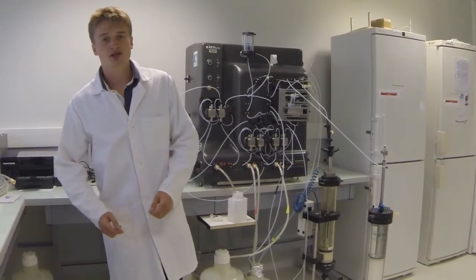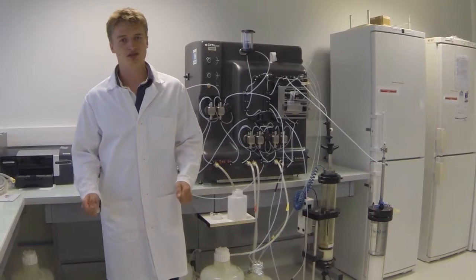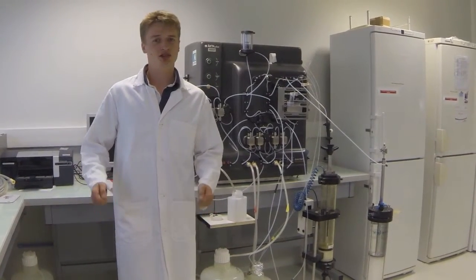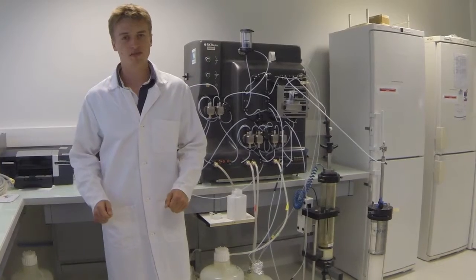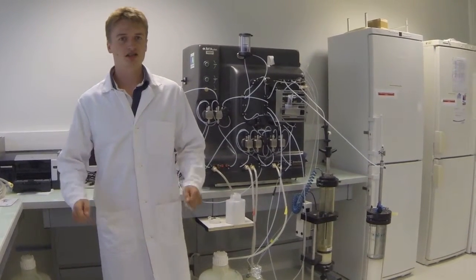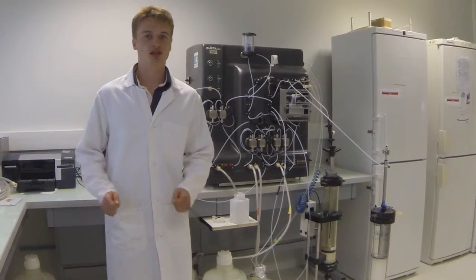The scale-up is a key step in a biotech process design. Most of the time, it's not easy to reproduce a process on bigger machines. Indeed, the geometry of the columns or the flow rates are not often suitable for industrial conditions. So, the biotech engineer's task is to predict changes and adapt the process to a larger scale production.